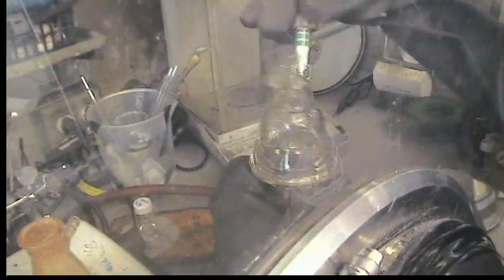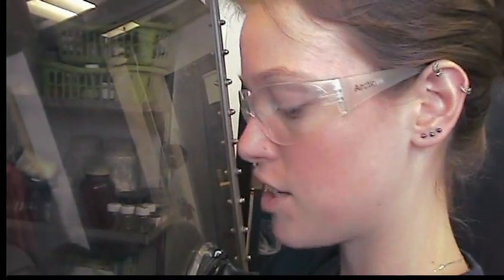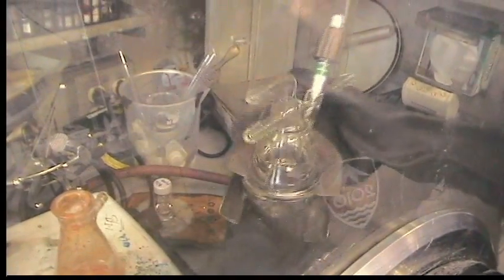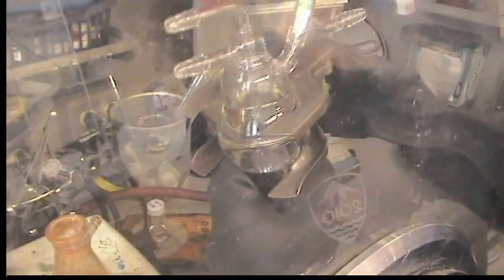How do you crystallize it? It crystallizes really well from toluene, so just wash this flask with toluene and put it in a vial. Sit it in the back of the freezer, and then when you need a few milligrams, it'll be there for you.